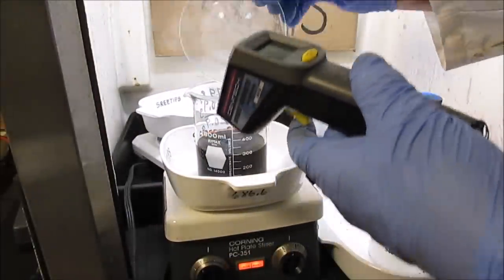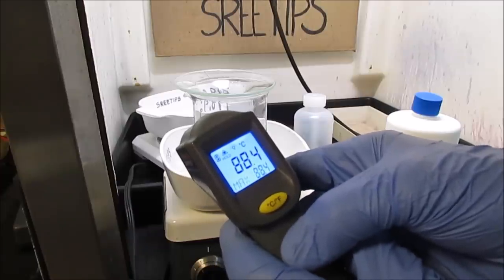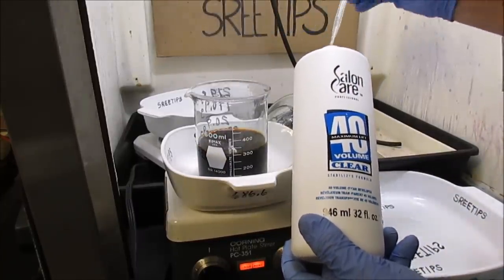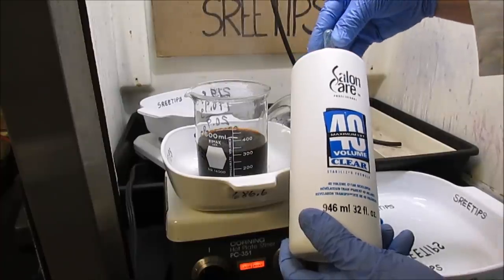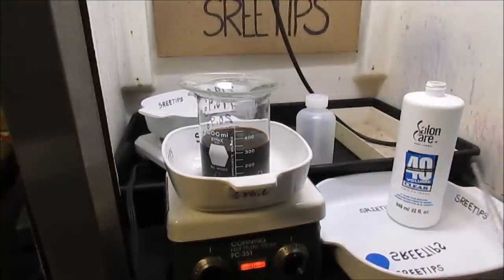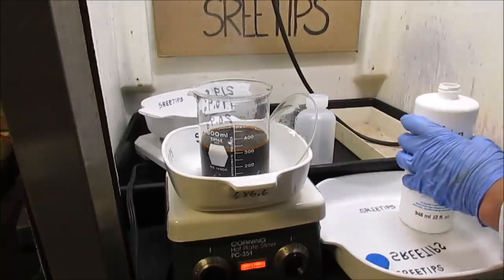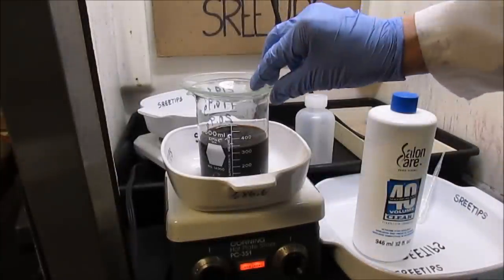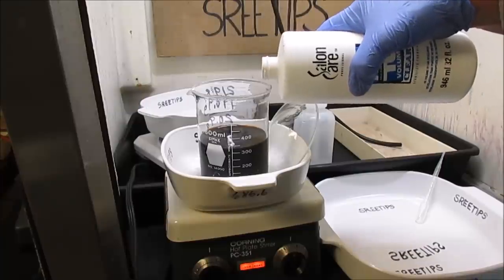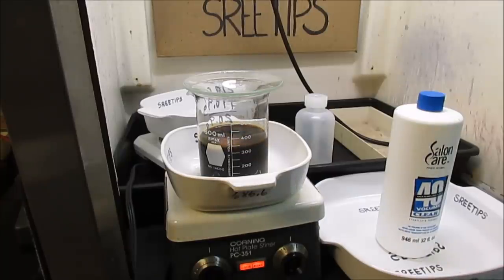We've been on the heat now for about 35 minutes, and we've got the solution up to 191°F / 88.4°C. I'm going to add some more hydrogen peroxide. I think I've got the solution up to the right temperature now. When I add the hydrogen peroxide, I get a bubbling reaction, as you can see. The solution's been on now for about an hour. I'm going to add some more hydrogen peroxide — just a smidge. We're still getting a reaction, so it looks like we've still got some more metals that have to dissolve.